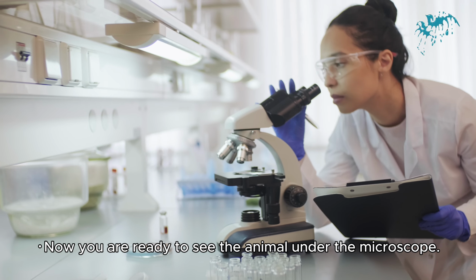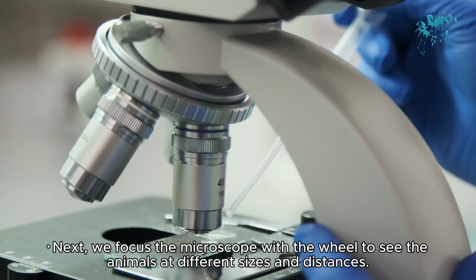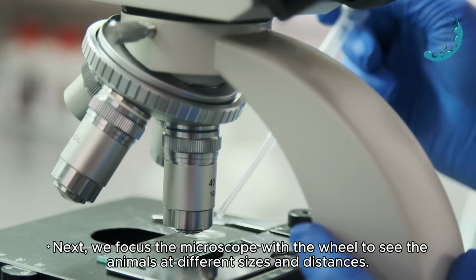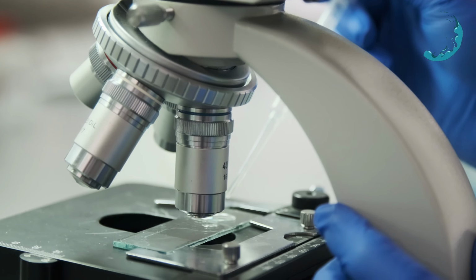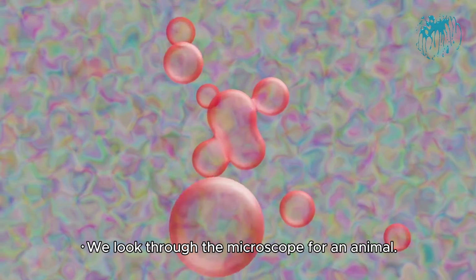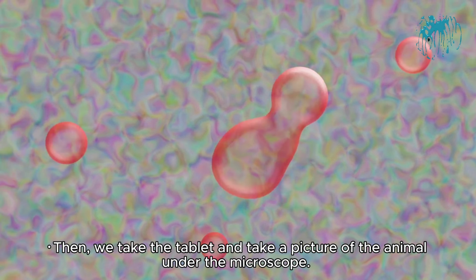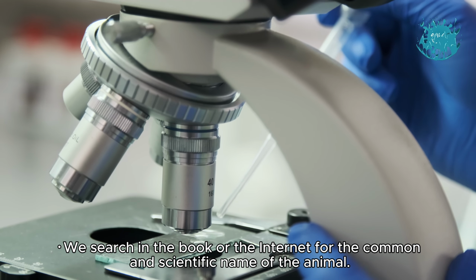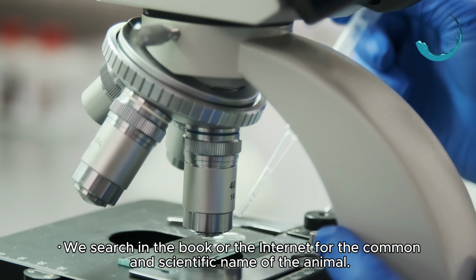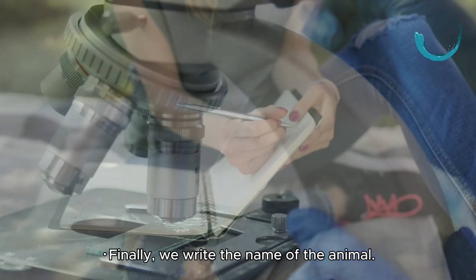Now you're ready to see the animal under the microscope. Next, we focus the microscope with the wheel to see the animals at different sizes and distances. We look through the microscope for an animal. Then we take the tablet and take a picture of the animal under the microscope. We search in the book or the internet for the common and scientific name of the animal. Finally, we write the name of the animal.